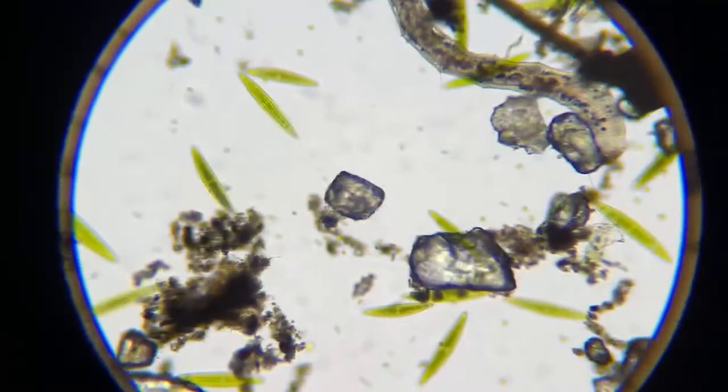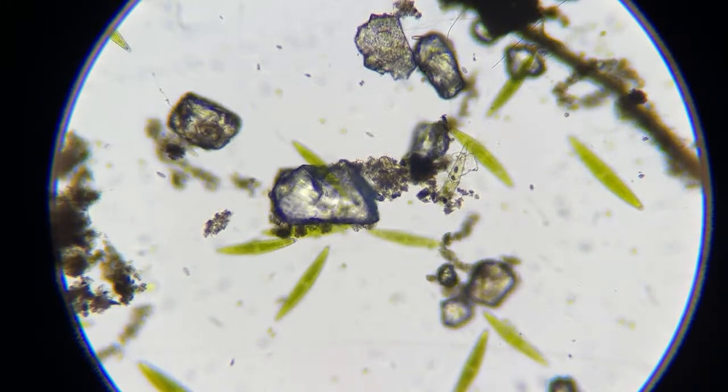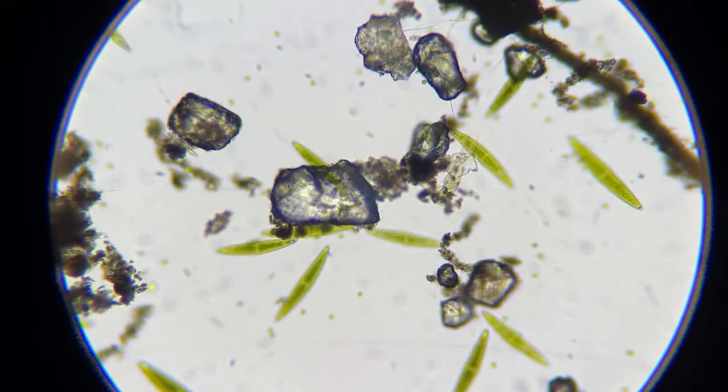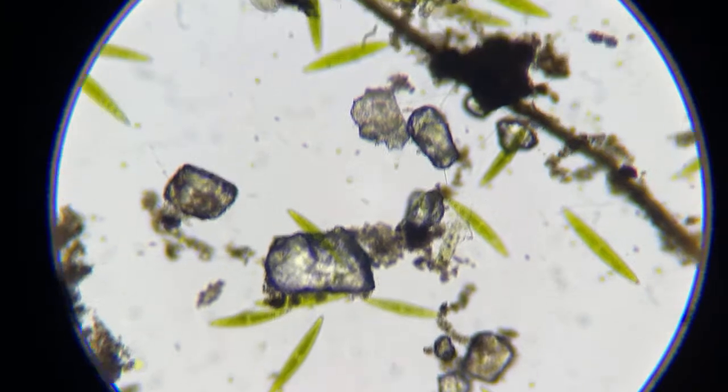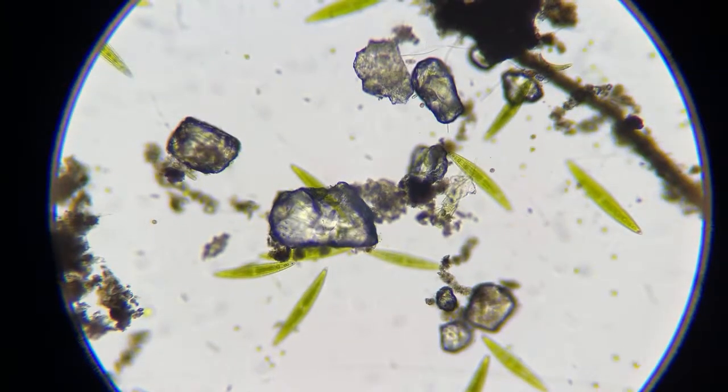Yeah, that sand, I know it's delayed. But those things right there, it does look like glass. Basically, sand is silica, I think, so sort of like glass. But that's 1 grain of sand.